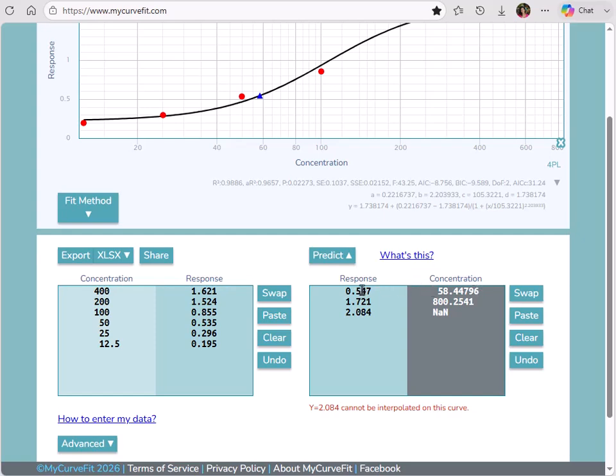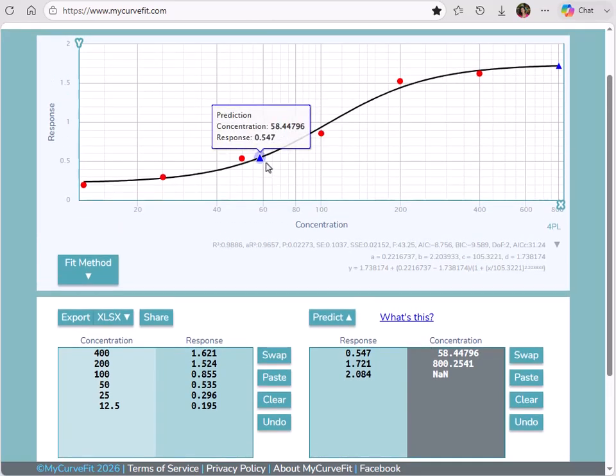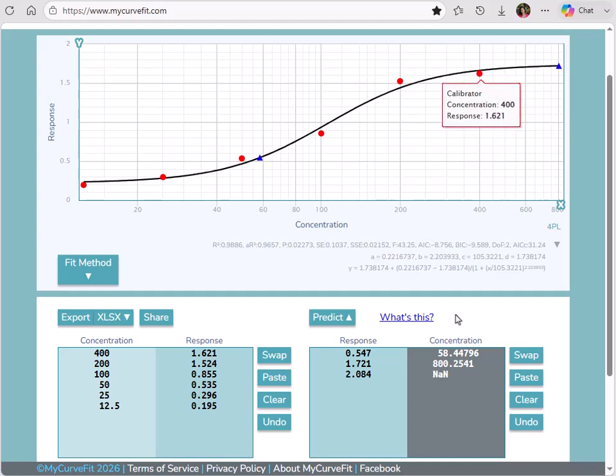The first falls within the range of the standards. You can see it plotted on the chart with this blue triangle. The second is outside the range of my standards, but within the range of the curve limits. For a sigmoidal curve like 4PL or 5PL, the curve limits are represented by the A and D parameters. For samples with responses between the A and D parameters, a concentration result can be calculated. This point is represented by the blue triangle to the far right of the chart. The third prediction is far outside our standard range and does not appear on the chart as it's incalculable for this curve fit. It's reported as NaN since it's outside the limits of the curve.